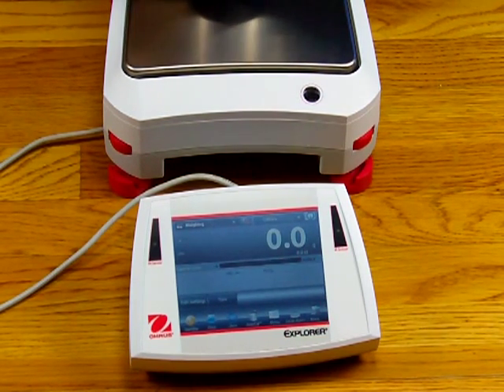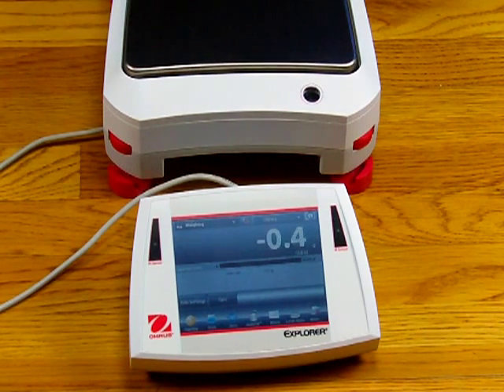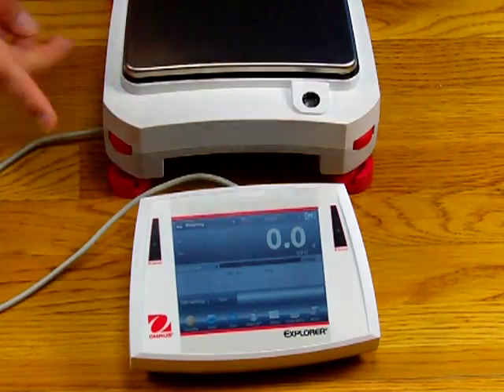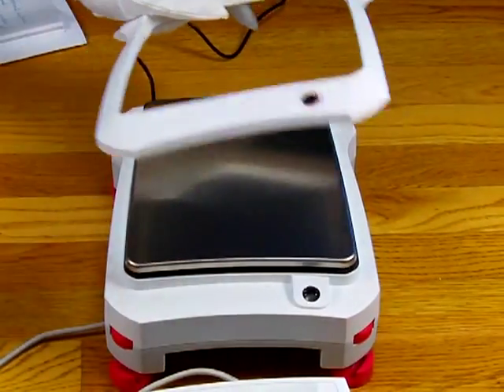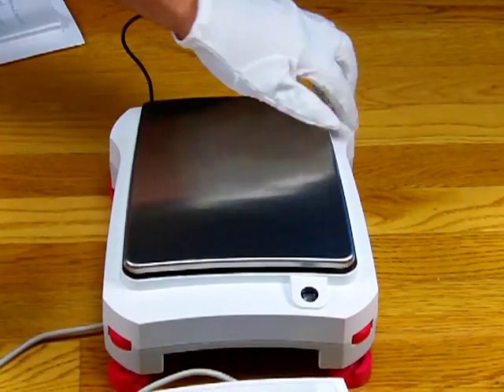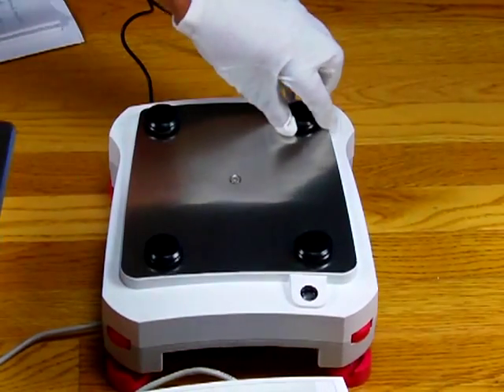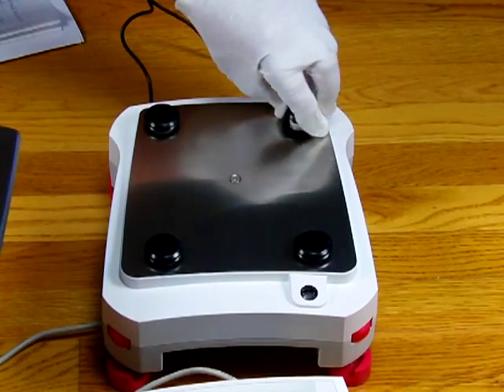And then calibration is done. Putting the calibration weight back on gives you confirmation — the balance is extremely accurate. Some other features: this is a windshield that prevents you from bumping the weigh pan. It places right on here. We have the weighing platform supported by four posts that hold the pan. The balance is extremely easy to clean.